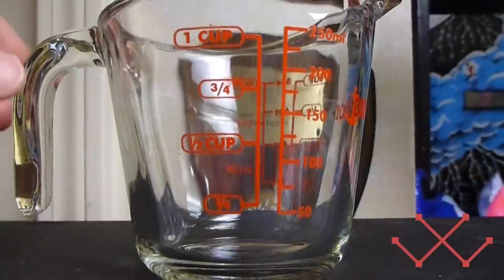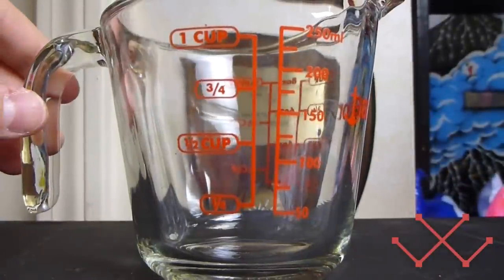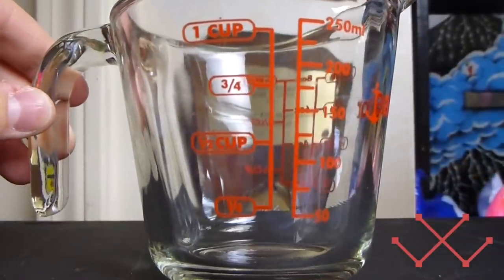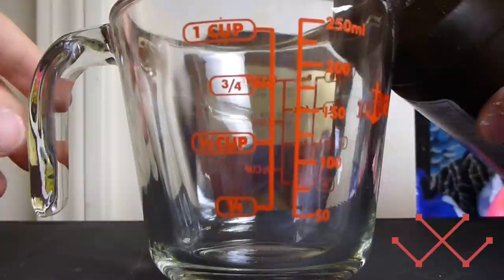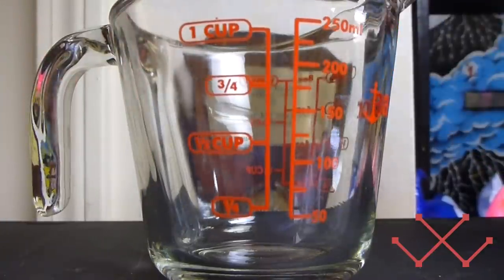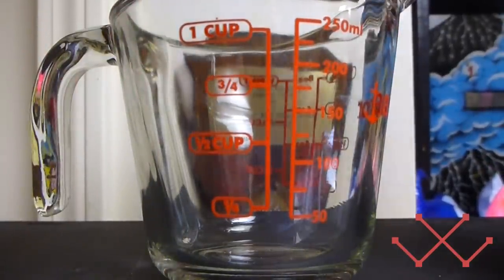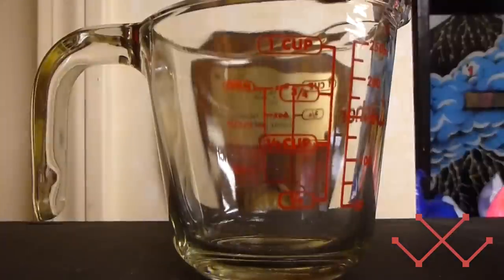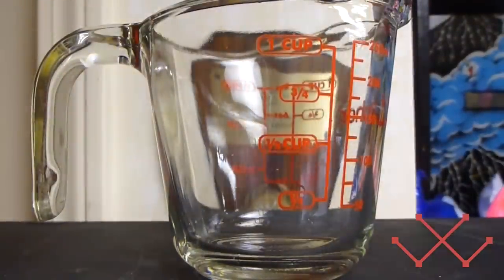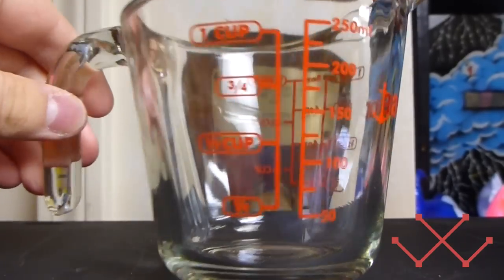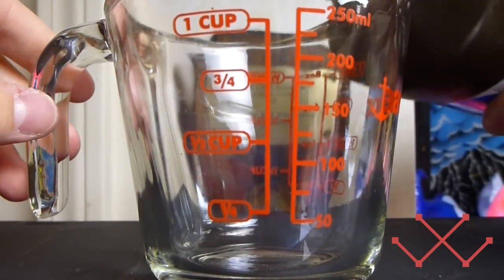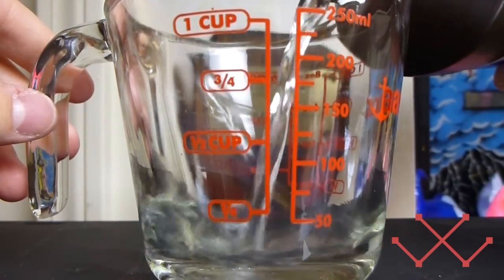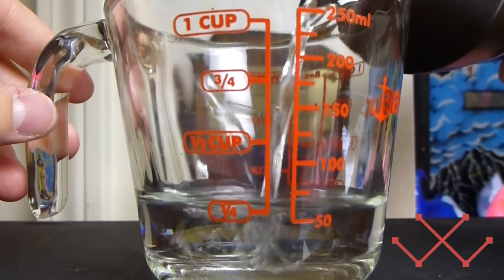So here's what you do. Might be a little hard to see in the camera because of the light. But I will verbally tell you what to do, too. You start with the hydrogen peroxide. It says hydrogen peroxide. Just so you know I'm not lying to you.